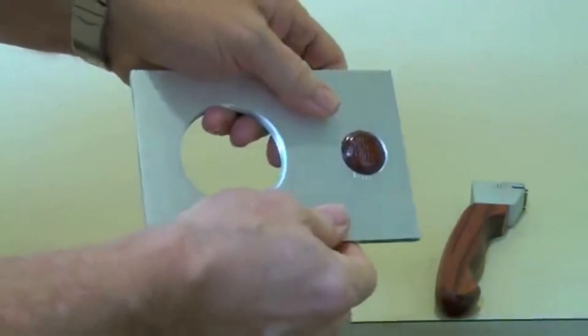We should be able to get a good cut. The CrossCut Test is covered in detail in the ASTM specification, where you may also find a quick reference guide.